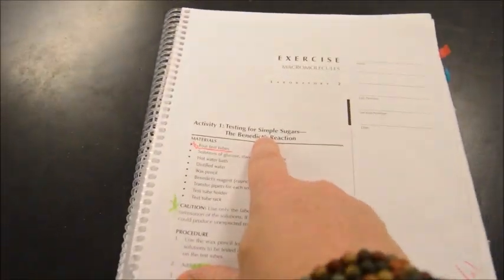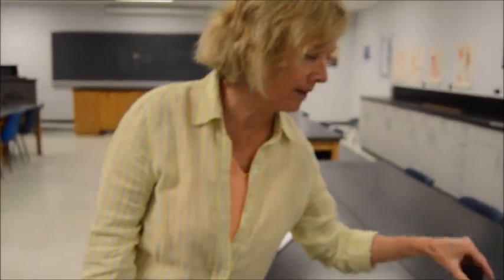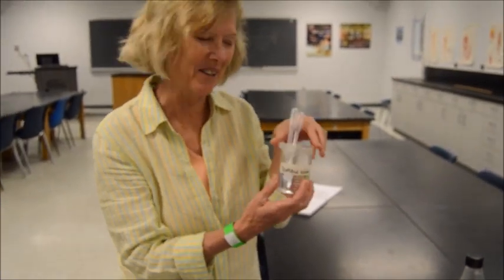Now, remember, positive and negative controls. A simple sugar, generally speaking, is going to be something like glucose. So glucose is a positive control, because you know before you do this experiment that this solution contains glucose, absolutely, without any question. And then a nice negative control by comparison. Well, what did we say before? You're really in trouble if there's anything in water besides water. So distilled water is our negative control today.